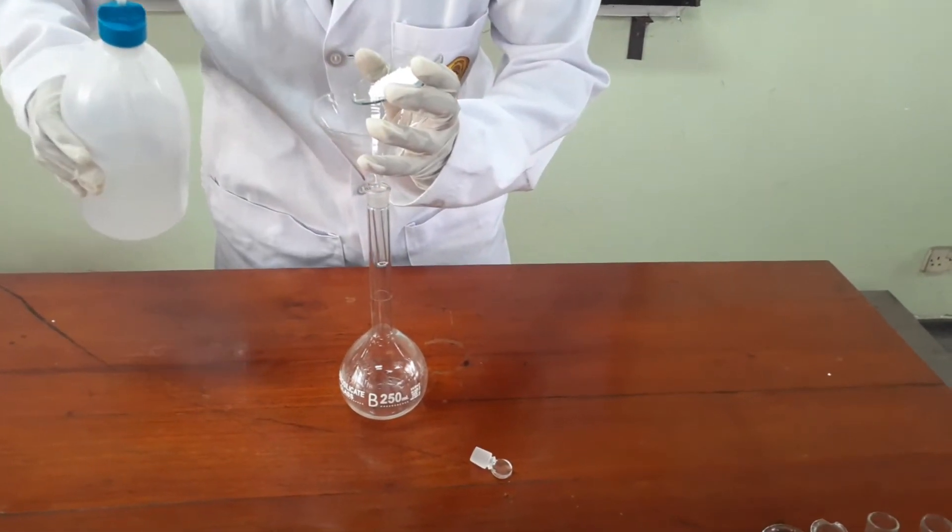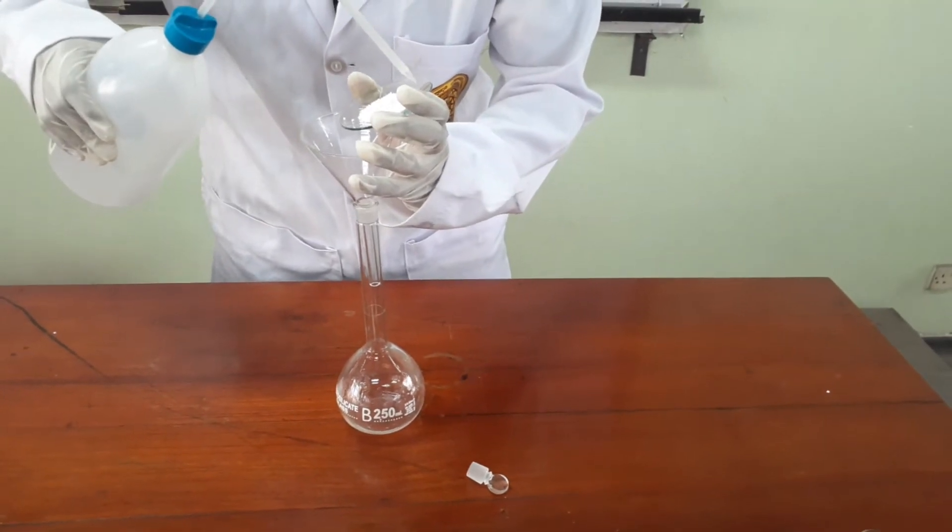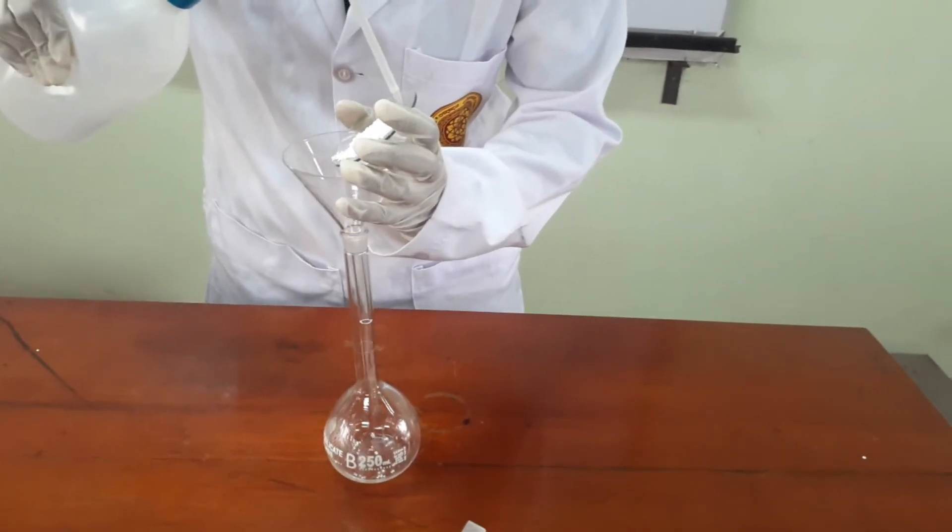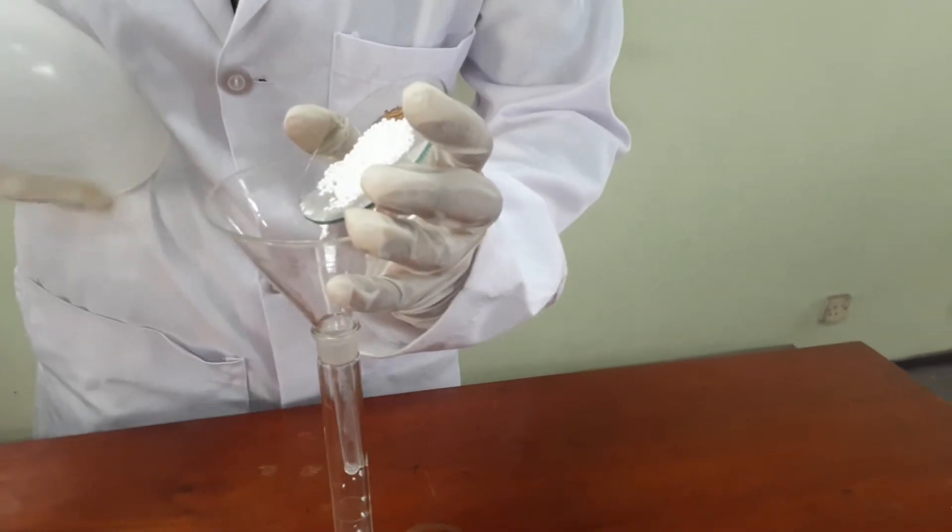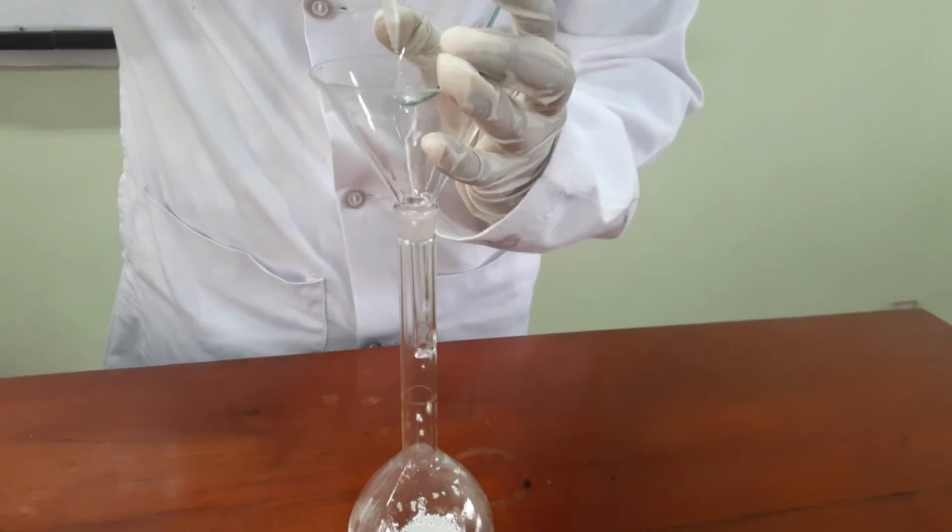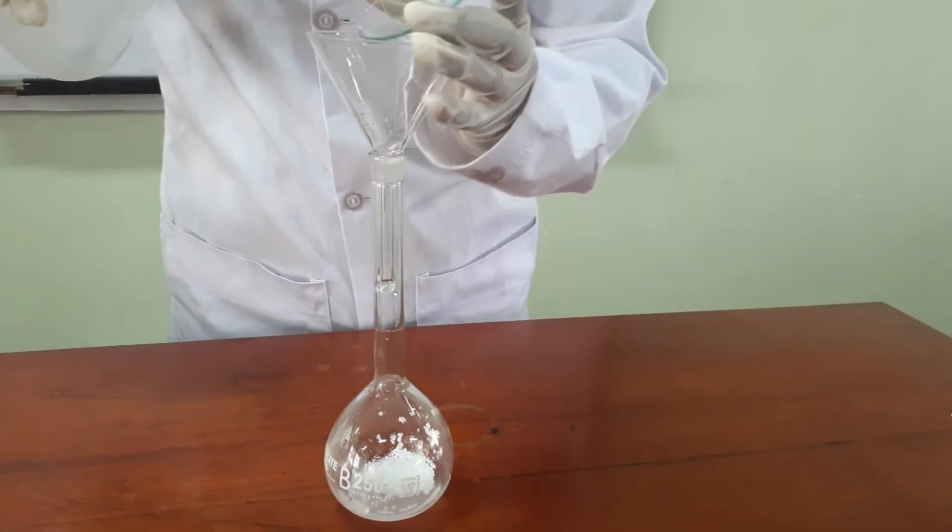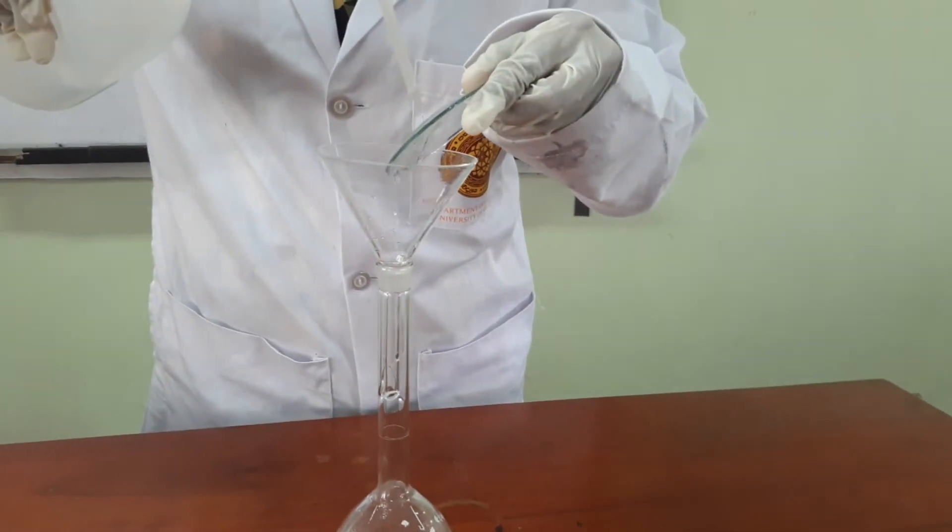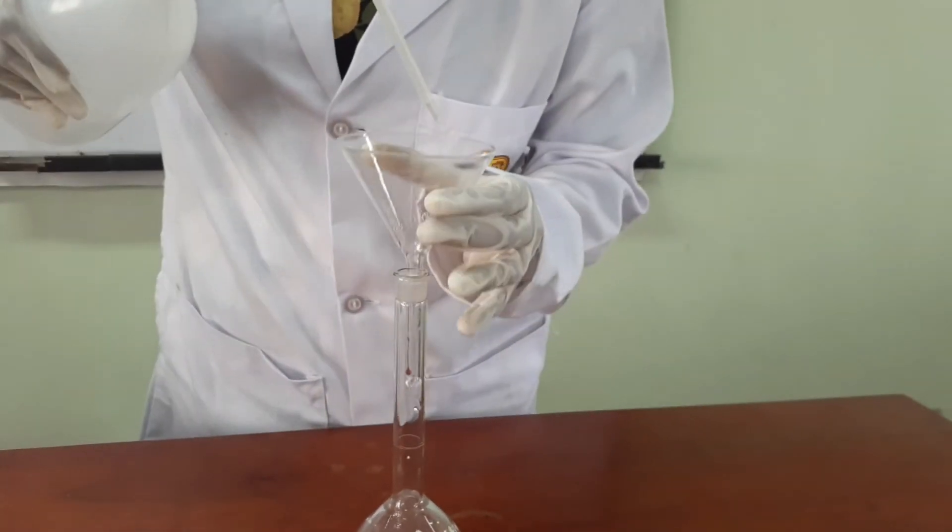Wash the watch glass with distilled water using the wash bottle. Then wash both the watch glass and the flask using distilled water.